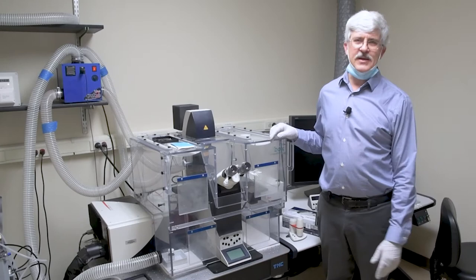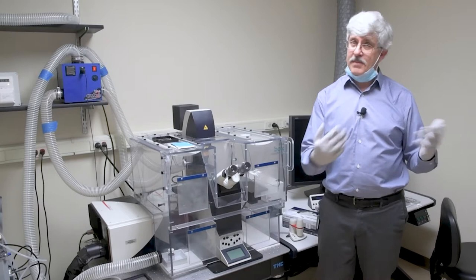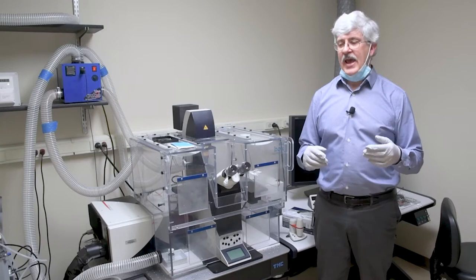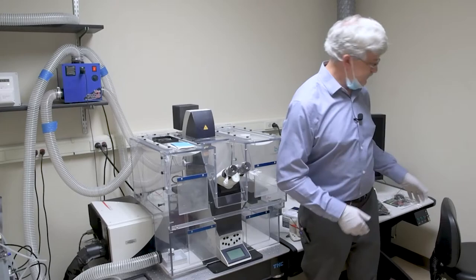Now we're going to make a small assumption here and that is that you're the first person of the day to come in and use this microscope. However, you don't really know what it's going to be when you first come here. We're going to go through the entire startup procedure and make sure that you know what buttons need to be pushed and how to get started. So let's begin.